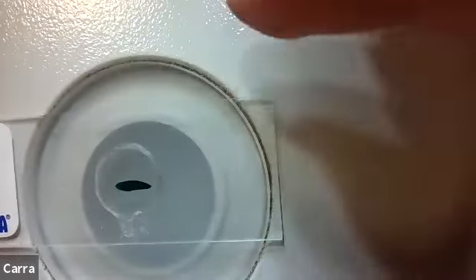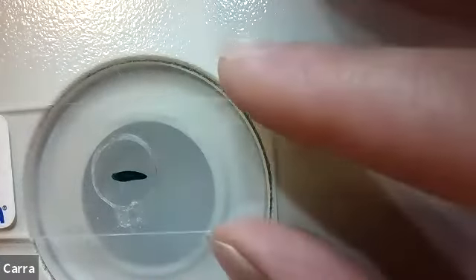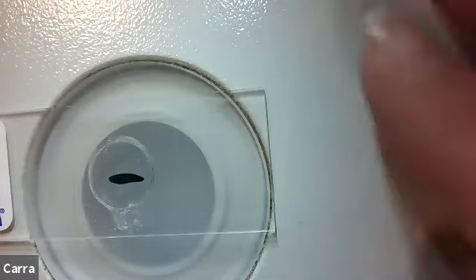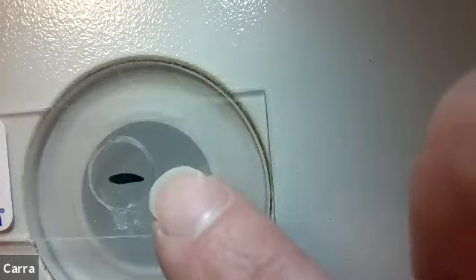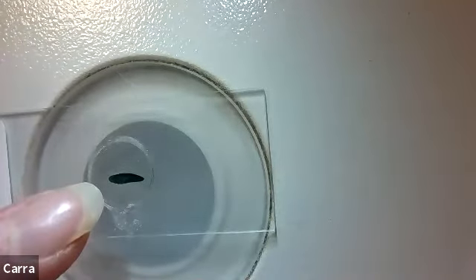It's okay. It's kind of nice that you can see how small it is, in comparison to my finger, for instance. All right. So it's pretty small, but it's in that weird in-between size where it's not that great to look at under the microscope because you have to look at it one little piece at a time. But under the stereoscope, our dissecting scope, it's a little bit too small. But one thing that I can tell you is the tail is tapered. So even when I'm just looking at it from this view, I can kind of tell what I'm looking at. So there's the tapered end, that's going to be the tail. And then here's the less tapered end, that's going to be the head region.